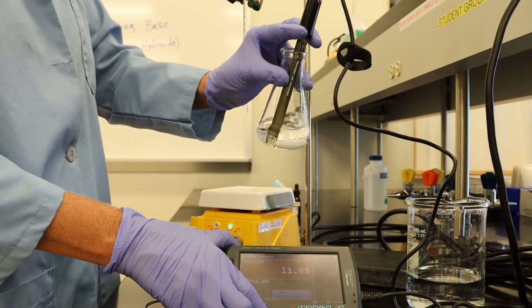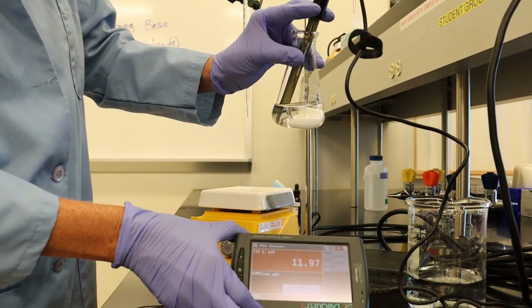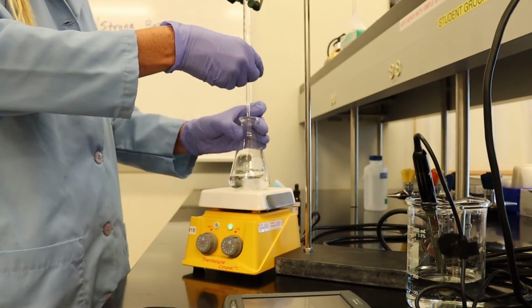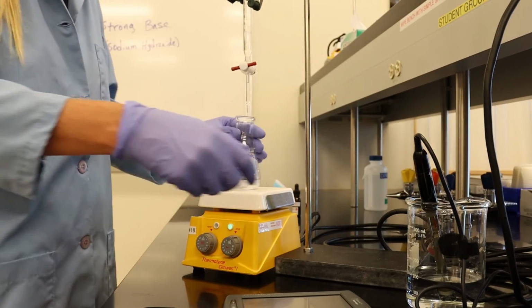Looks like we're at 11.88. 11.98. I'm going to add another milliliter.